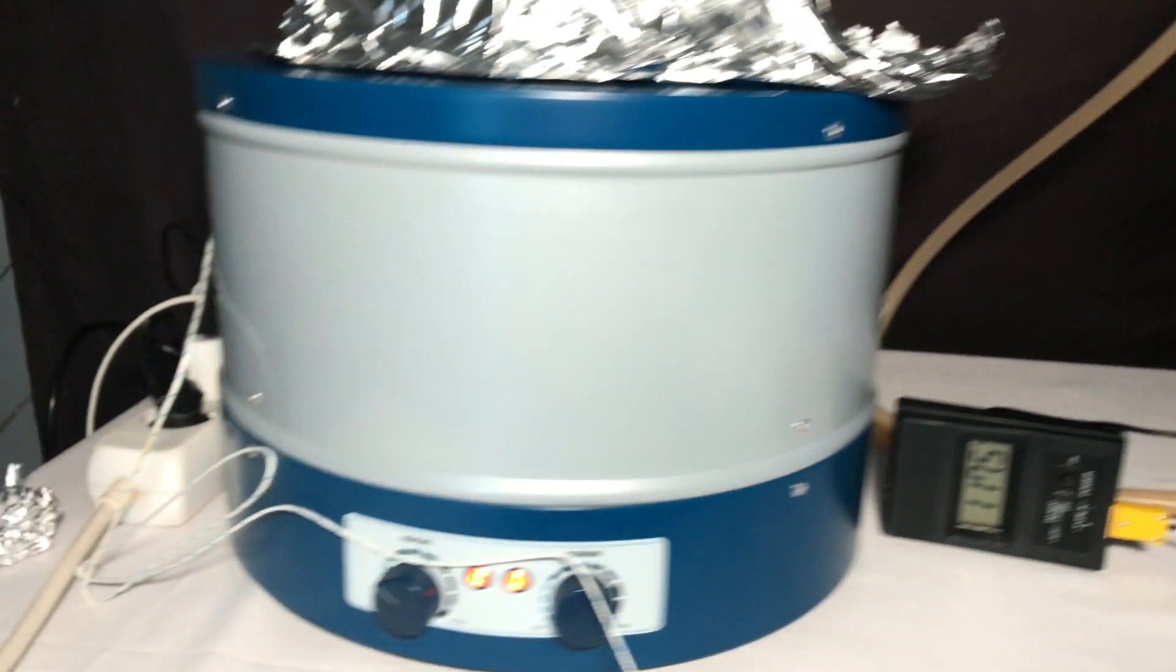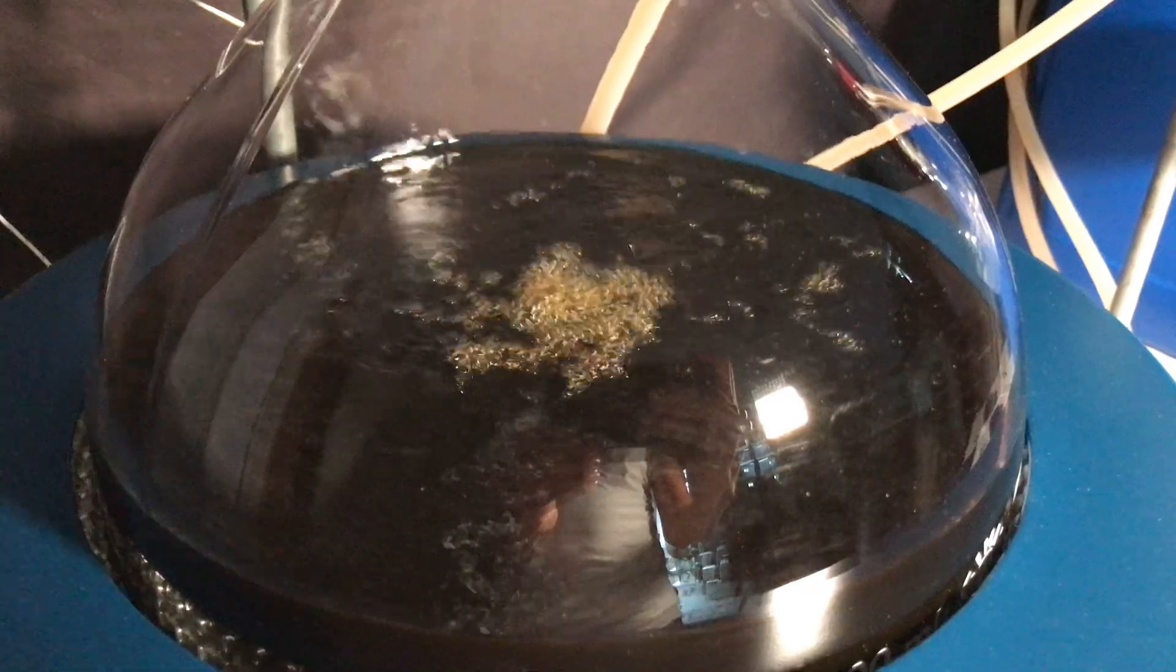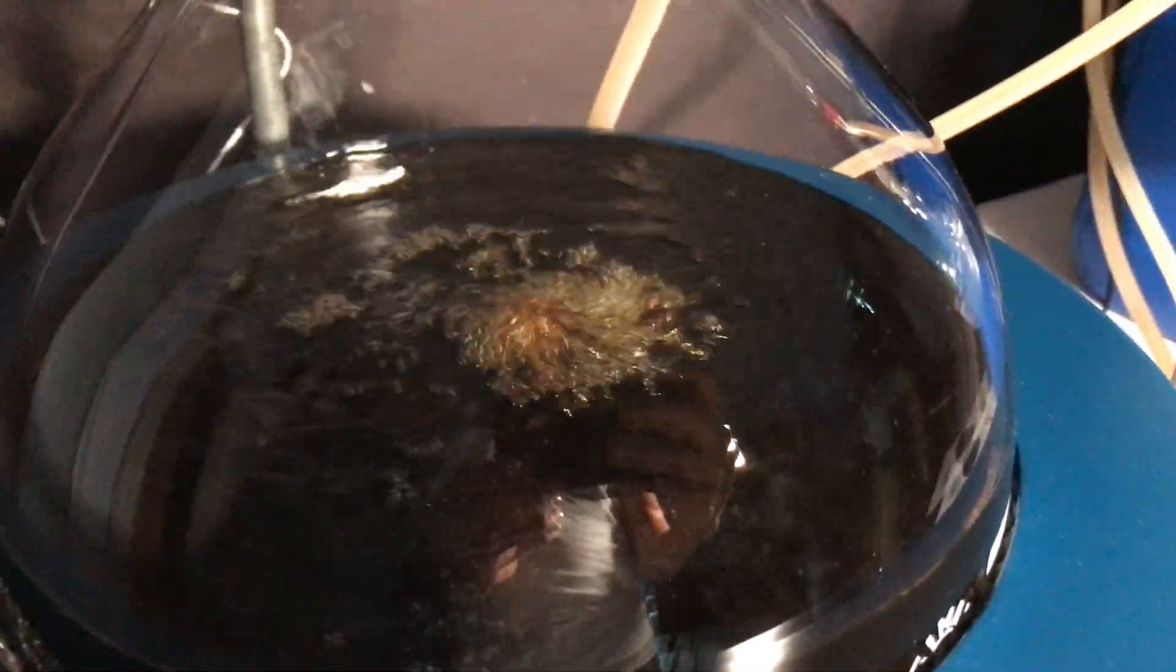The benzene which we distilled off looks cloudy. This is actually a good thing because it means that we removed even more water. The solution in the boiling flask looks black and this is not a good thing.